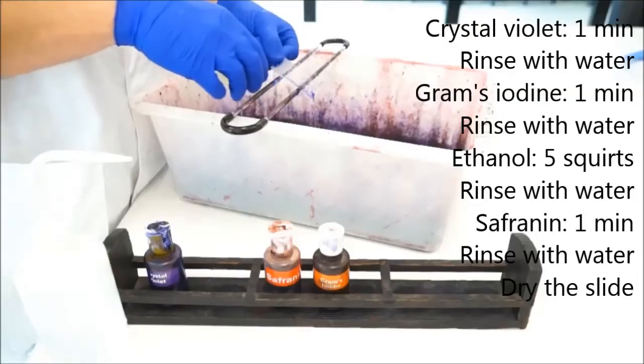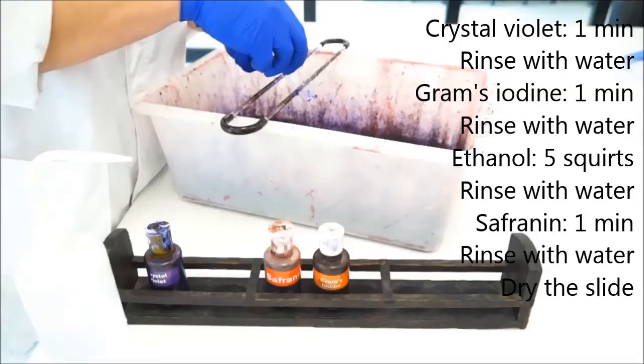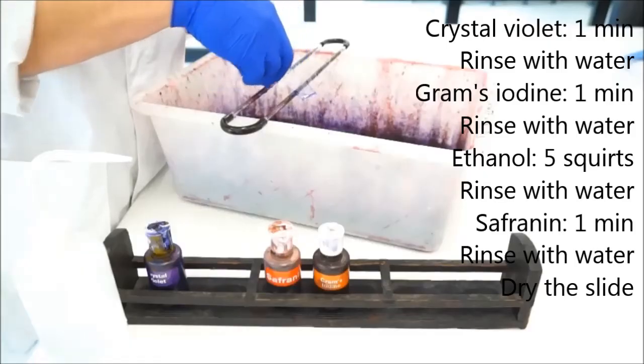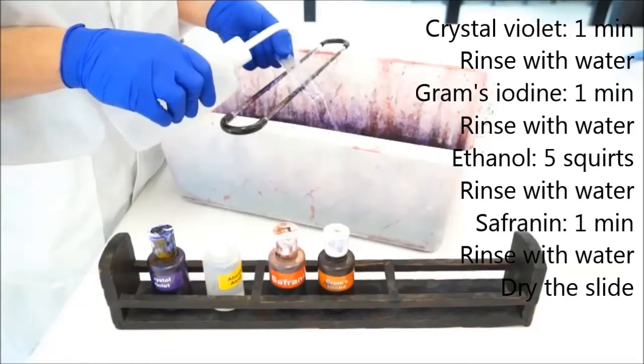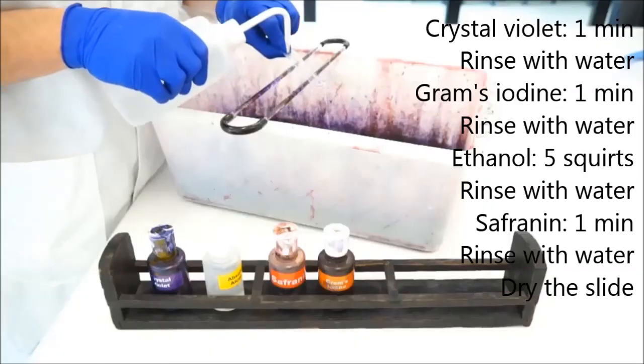Count five times. So we've got one, two, three, four, five. Then immediately get some water on there to make sure that it doesn't decolorize too far.